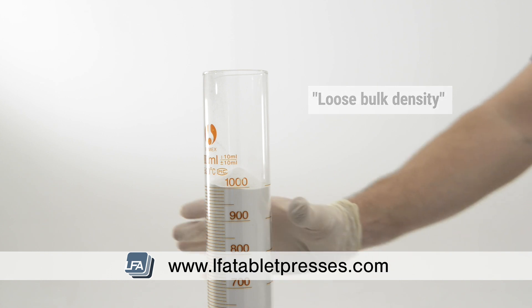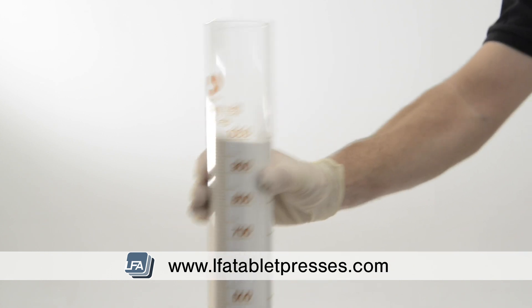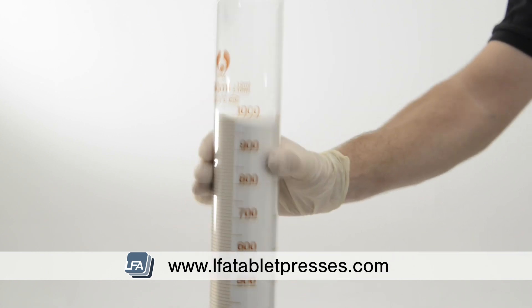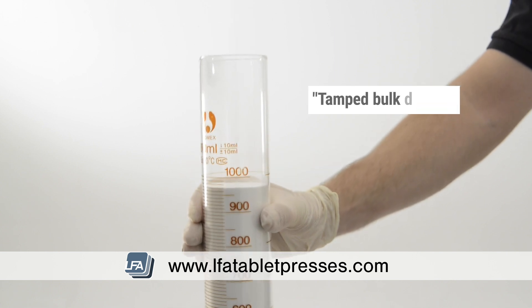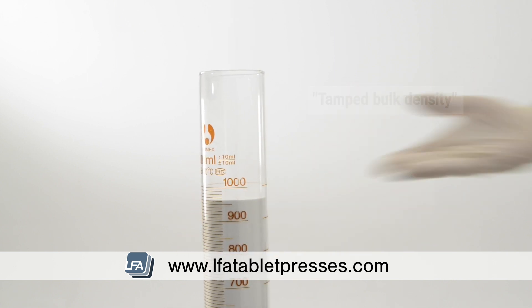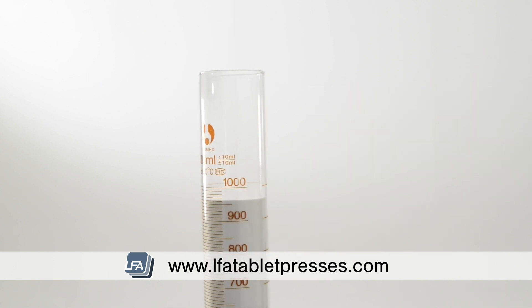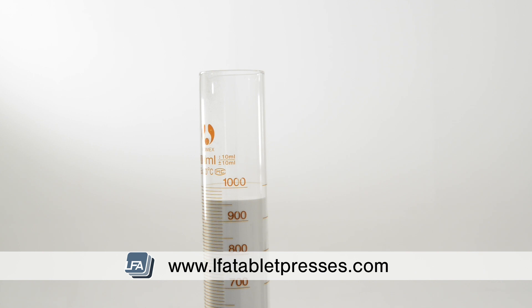As an example, if we shake our cylinder you'll see the powder compact. This is known as your tamped bulk density, which we're not interested in. Next, record the weight of the 1 litre of powder.